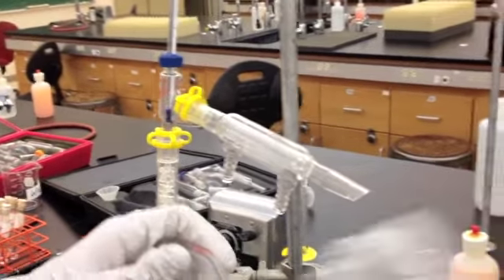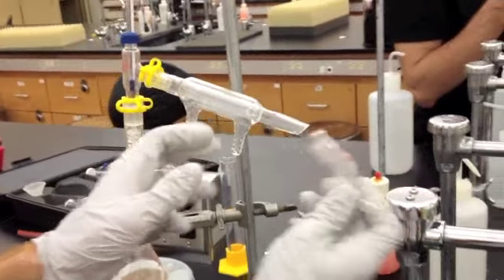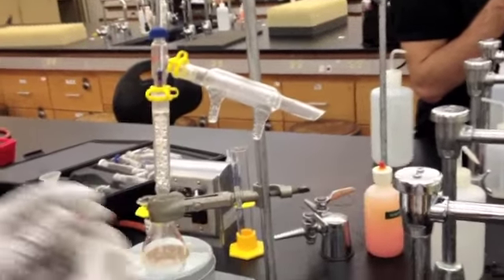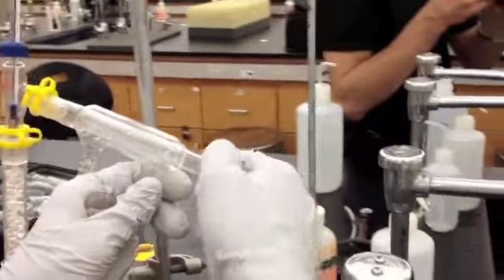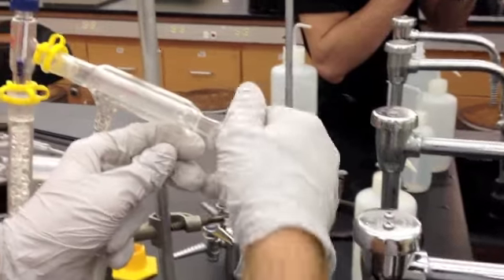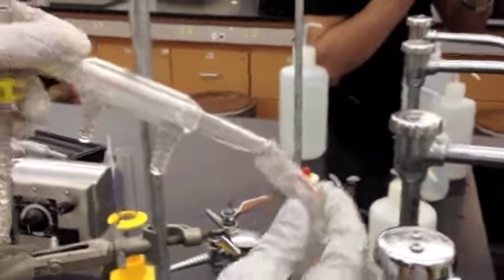Now, you're going to add the last piece of your apparatus, which is the vacuum adapter, just to give it some air and to direct it downwards. If it doesn't go in, grease the joint. Again, always grease the male joint. And that will allow it to easily fit.